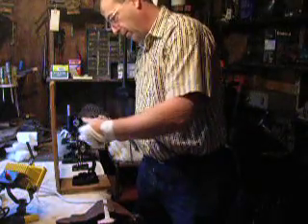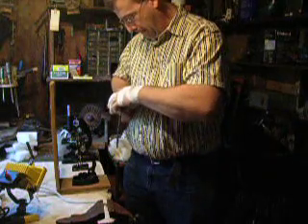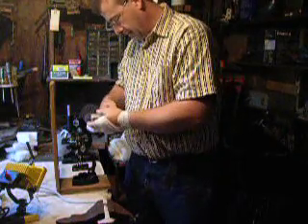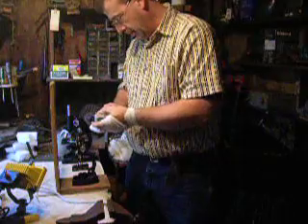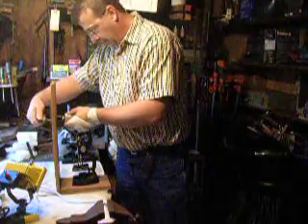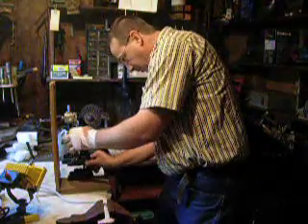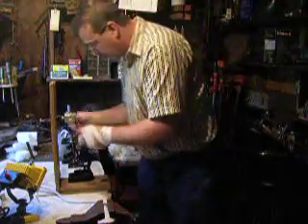And along the edge, you find a good spot to attach it to the edge. Now this was configured for another camera, but the idea is then all you do is you put the microscope directly under the lens.